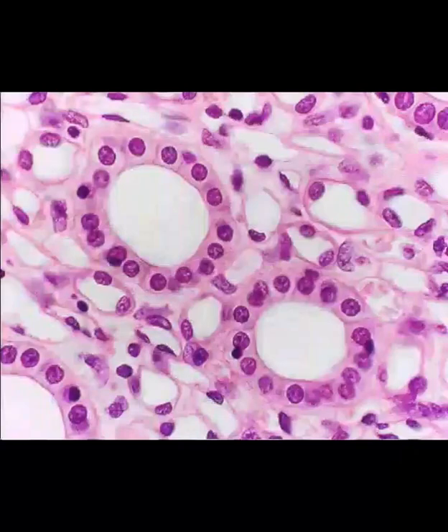So here we have a picture of the kidney tubules under the microscope, and we're looking at the two large circles near the center of the picture, and they are going to be lined with the simple cuboidal epithelial tissue. And this one's not too hard to figure out. There's just one layer of cells, so it's simple, and the nuclei line up pretty nicely, and it's just a cube-shaped cell, and that's how you tell if it's simple cuboidal epithelial tissue.